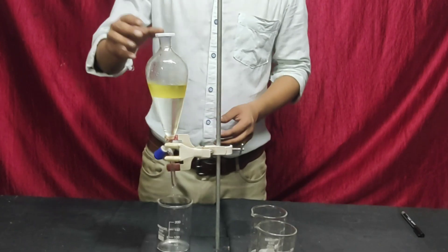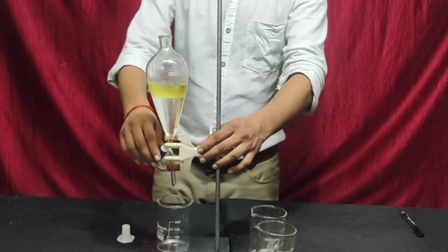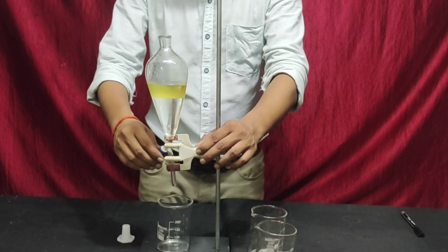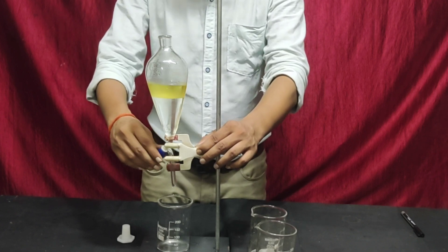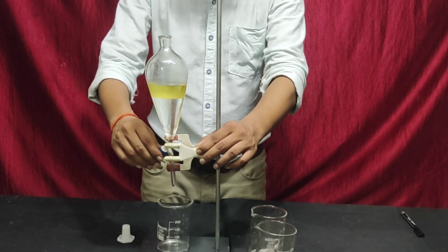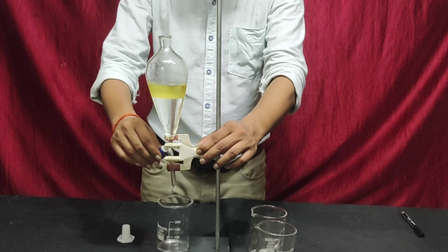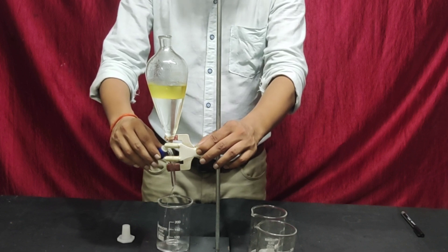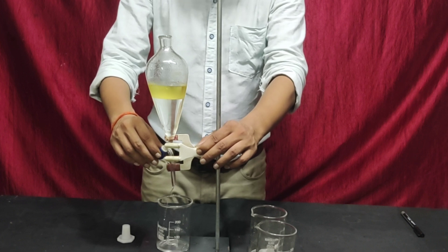First, remove the cork. Now open the stopcock slowly and carefully and allow the lower layer to flow down into another beaker. Care must be taken that the flow of liquid is not too slow or too fast.